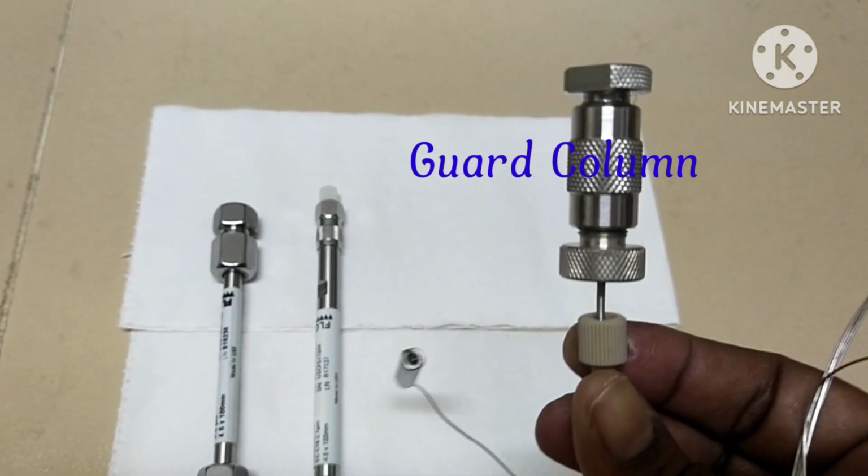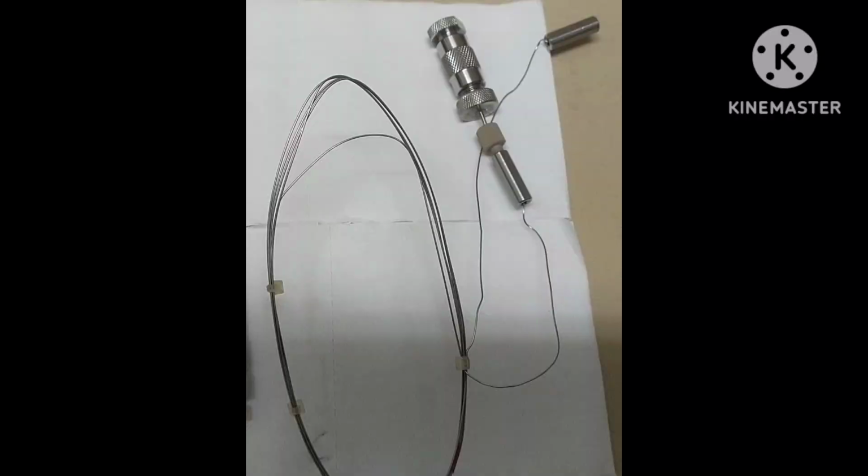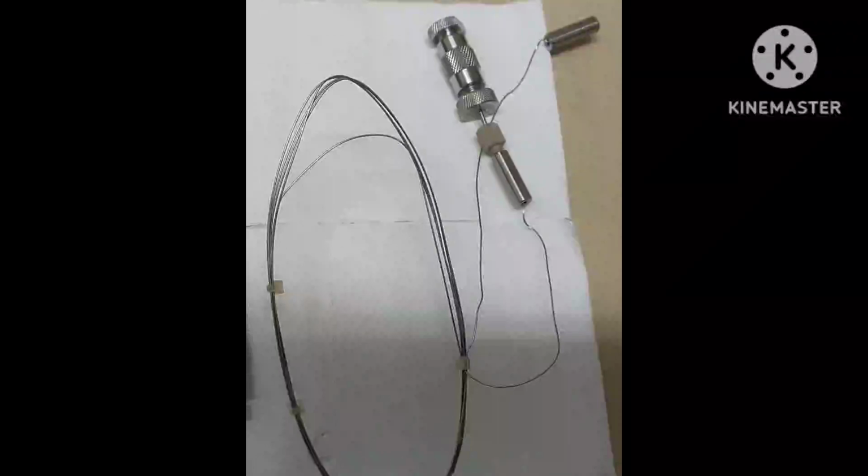It is a guard column. The guard column is installed between the injector and the analytical column. It is designed to increase the lifetime of an analytical column by protecting the analytical column from unwanted materials such as highly retained or irreversibly retained compounds and particulate matter.